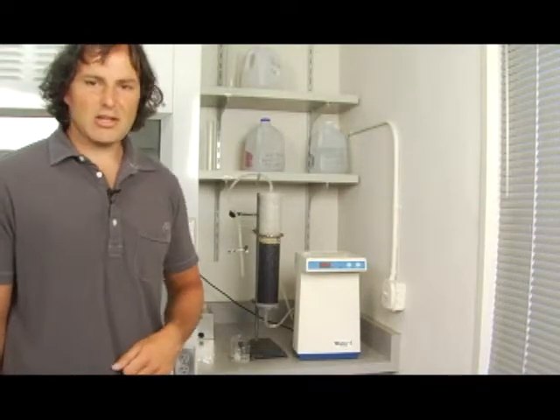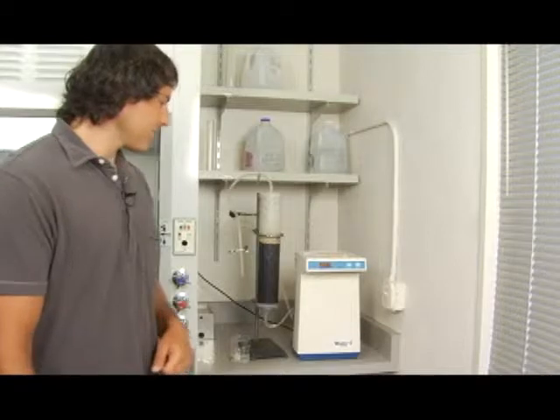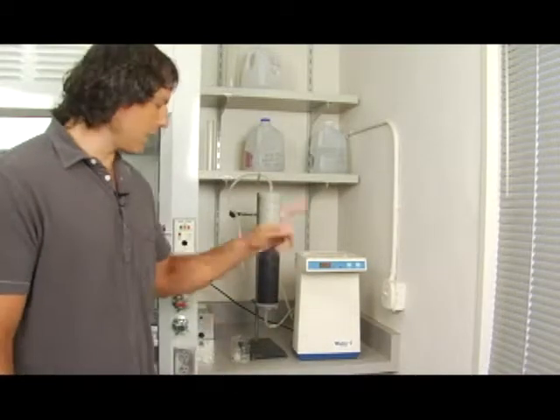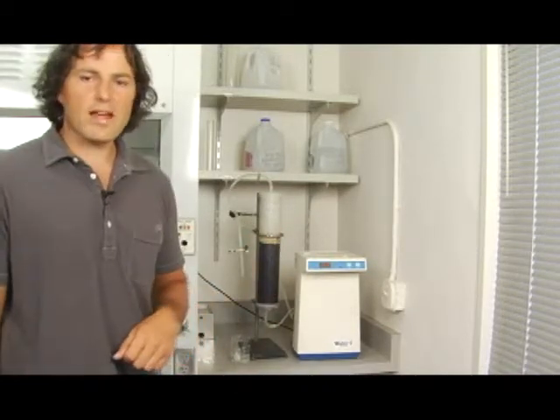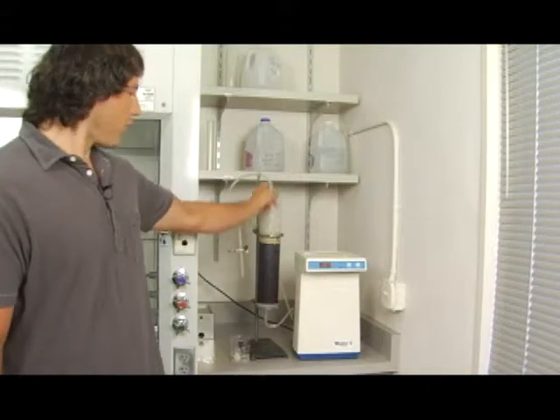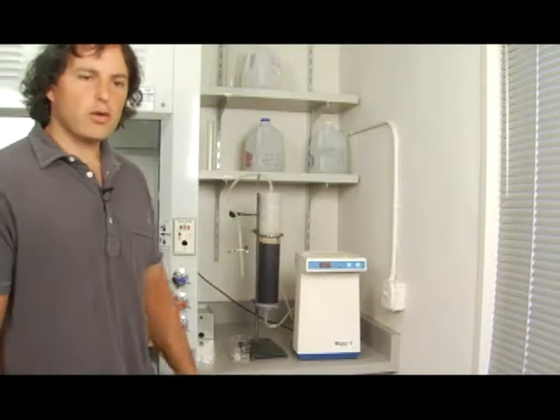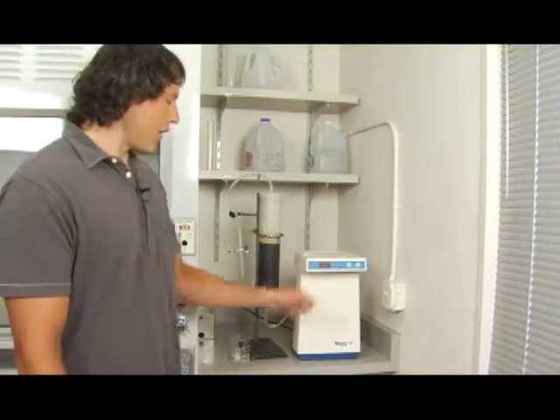It's changing on us though. As it filters through, it gets water that's been purified and water that hasn't been purified through. Once all the water's been forced through here, our value will definitely be over 1. So now we have 1.88.